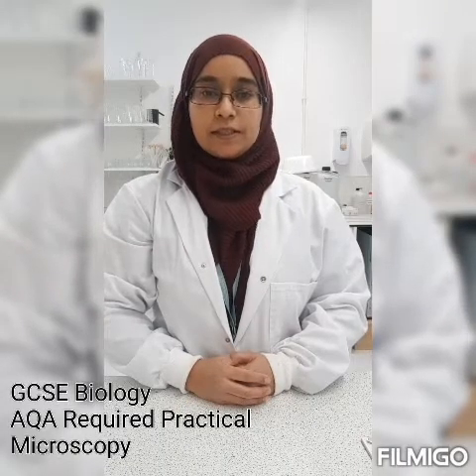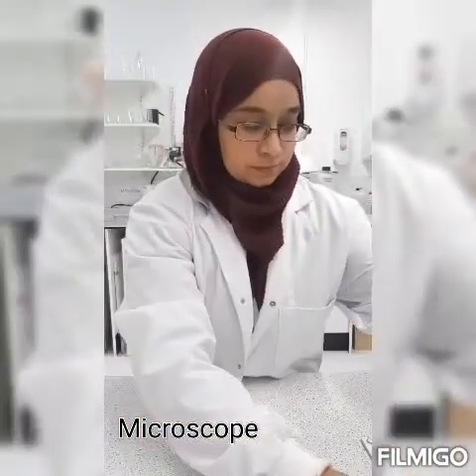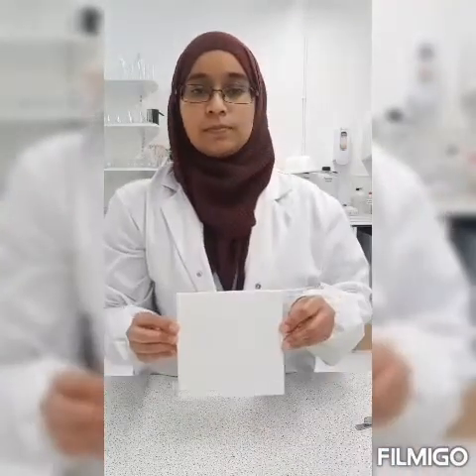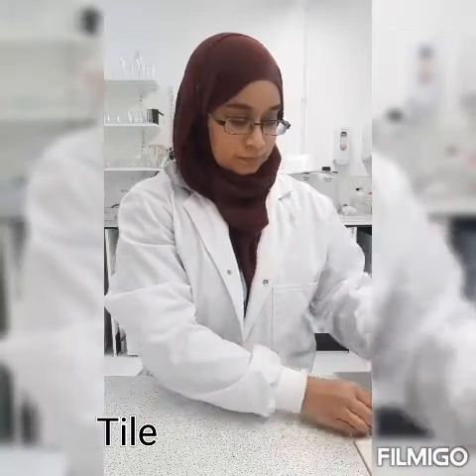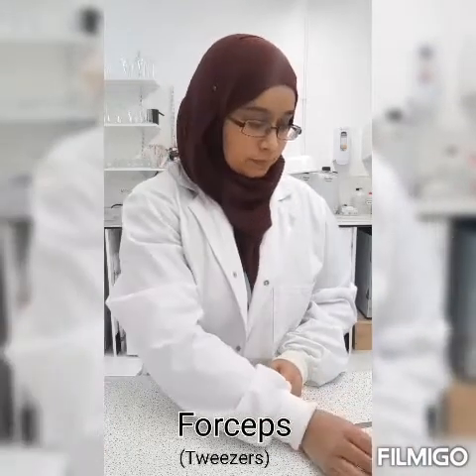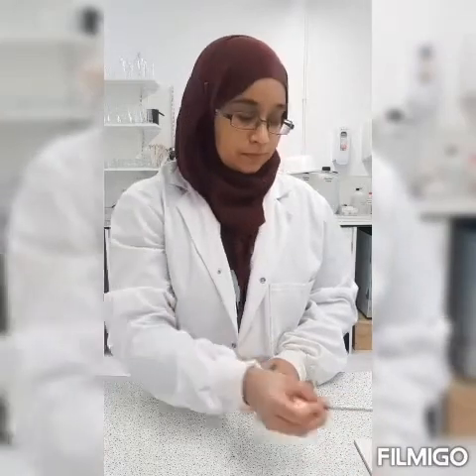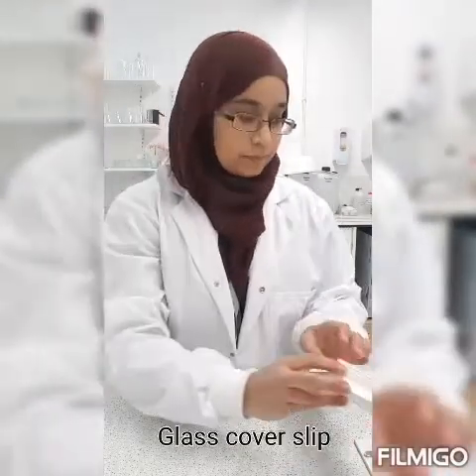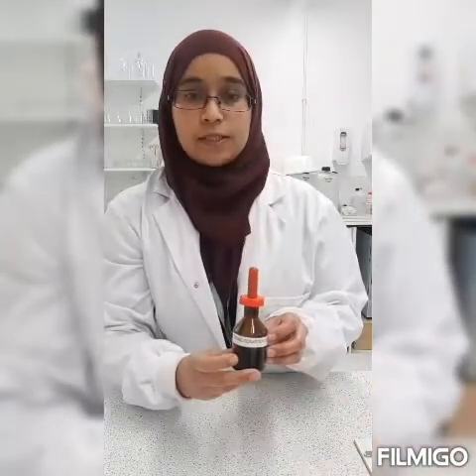Today's AQA required practical, we will be doing microscopy. What you will need for this practical are the following: a microscope, onion, a tile, forceps, scalpel, microscope slide, glass cover slip, some iodine solution, and a ruler.